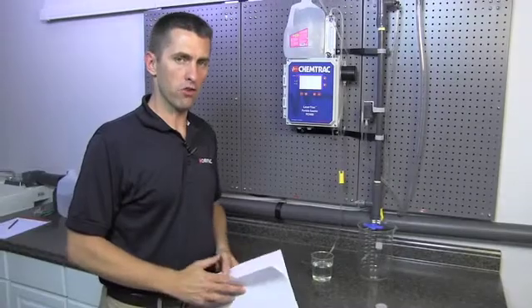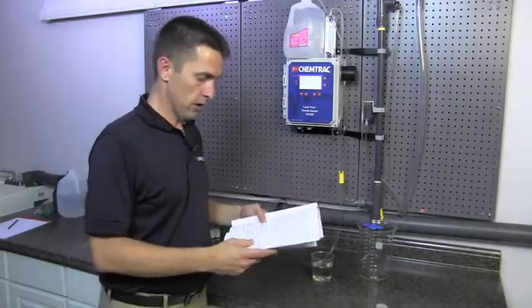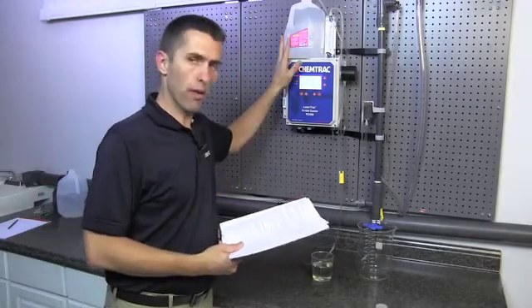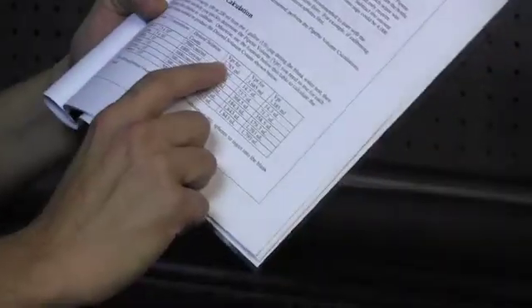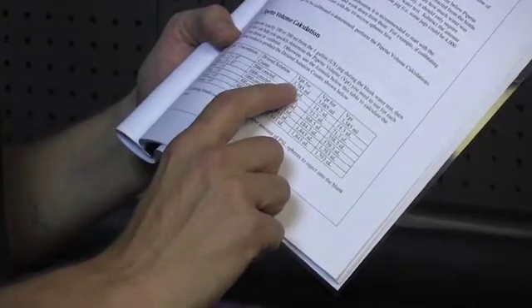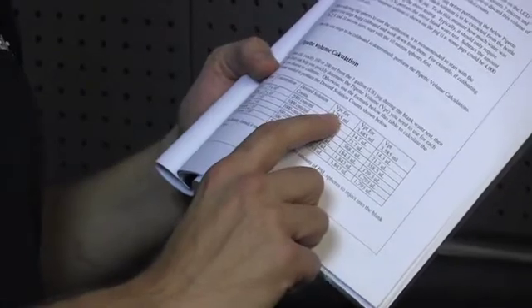Now that we've completed the blank water check, if you're following along in the procedure, we are at section 7, which is determining how much of the PSL spheres we're going to be adding to our blank water. And the table shown on page 8 of the procedure, we're going to be doing a 2 micron calibration first. We see how much we need to pipette in. The jug was full at 3,785 milliliters.